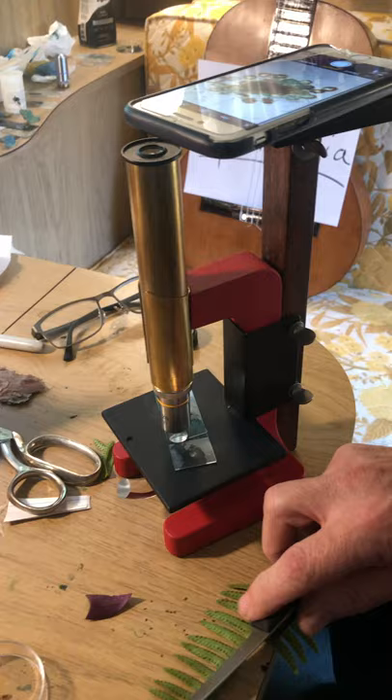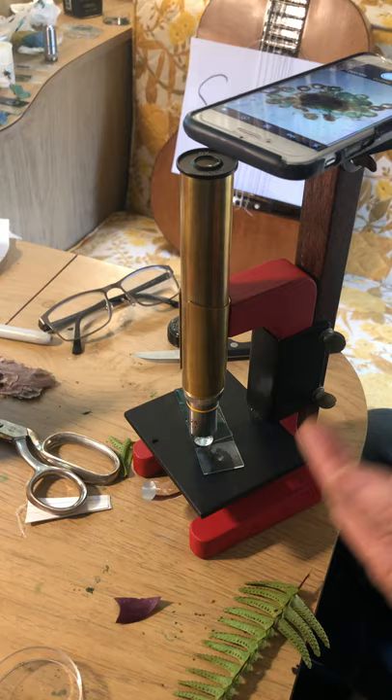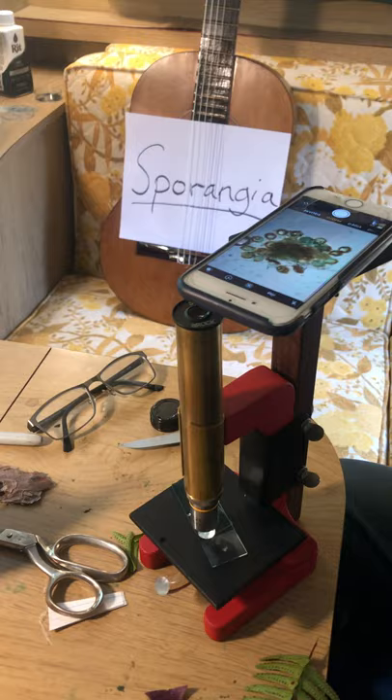They're very hard to see at low power; you need higher power. We're going to do that later — we'll probably put a 40x on there. What magnification are we at? That's a very good question. You see the yellow ring down here? That tells us that's a 10x objective, and then you've got a 5x eyepiece up here, so you have a total of 50x.